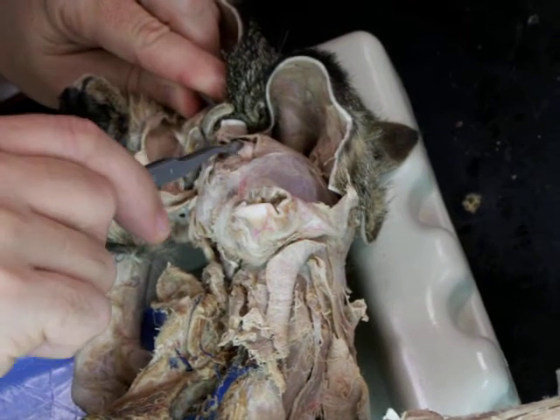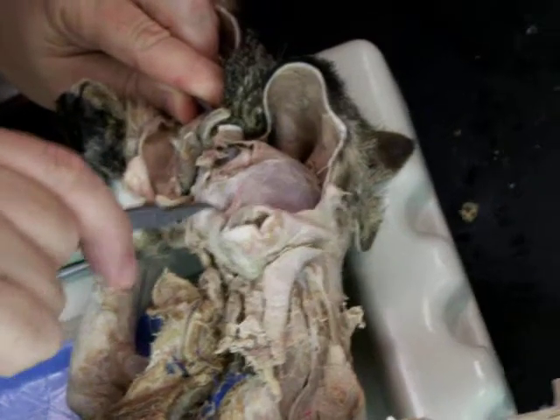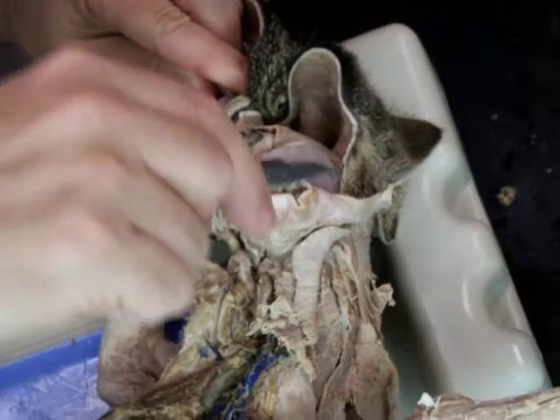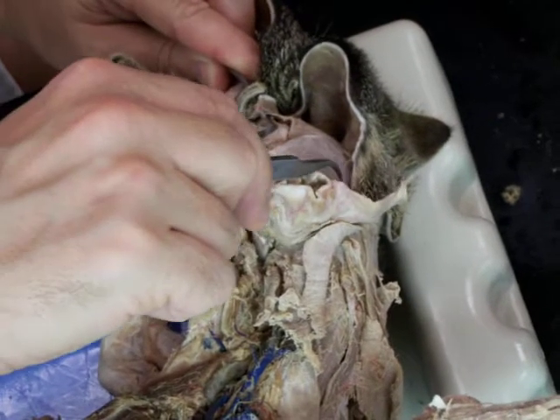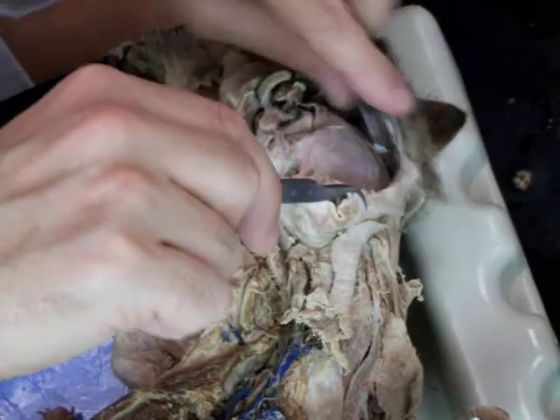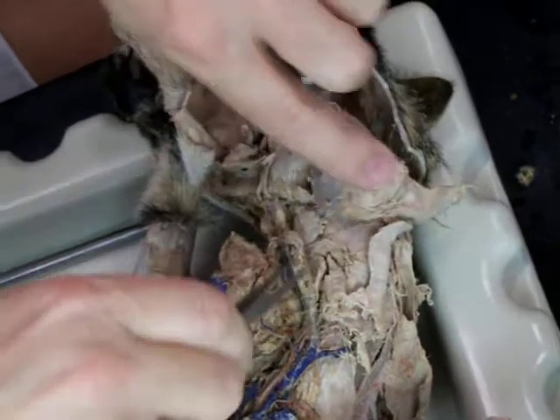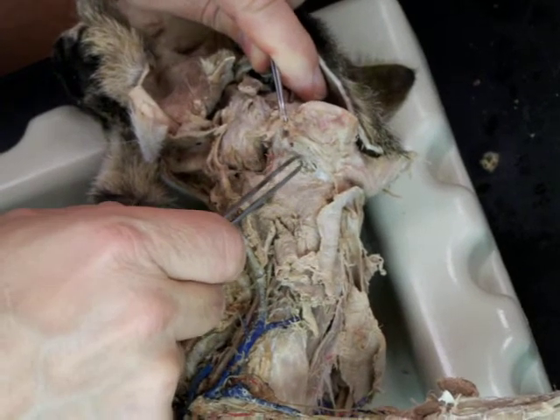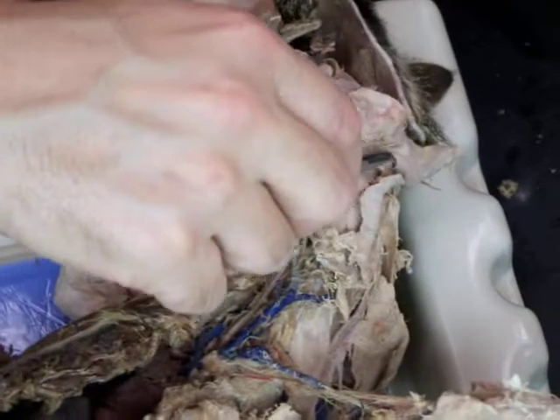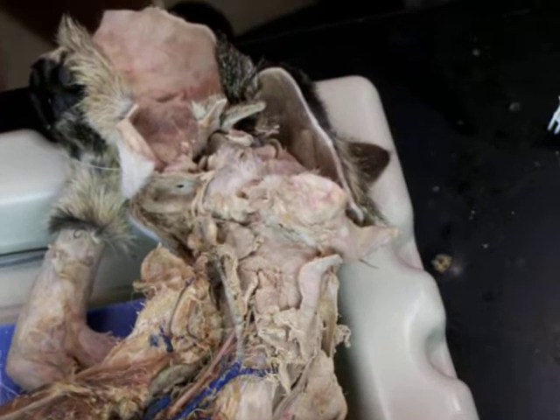I think this is all facial here. I don't see much of yours. The superficial temporal is going to go right up here into this fascia up here in front of the ear. And the caudal auricular, usually you have to dig down here to see that. You see this artery right back here, caudal to the ear. It runs up and around the base of the ear on the occipital region of the skull, the back of the skull.